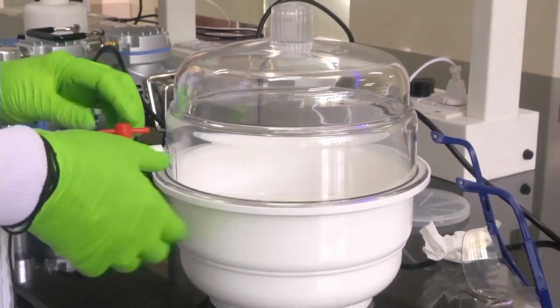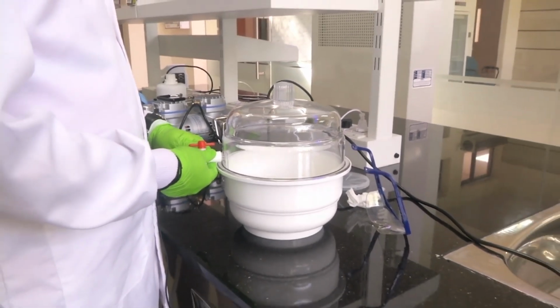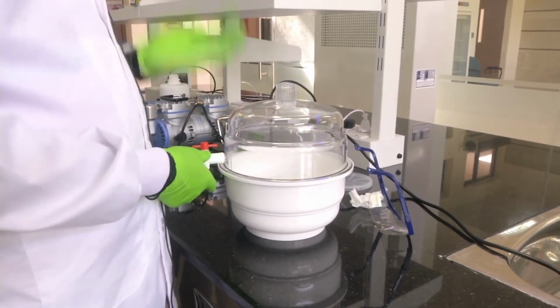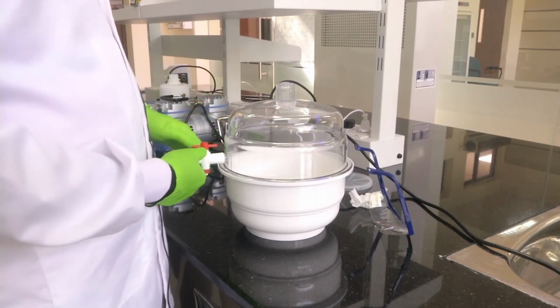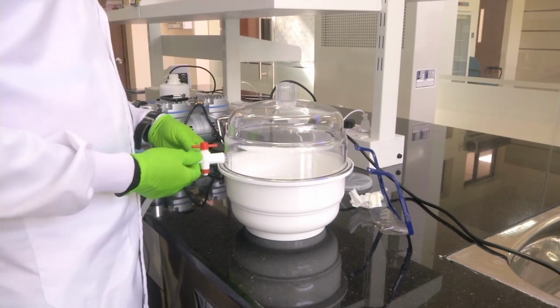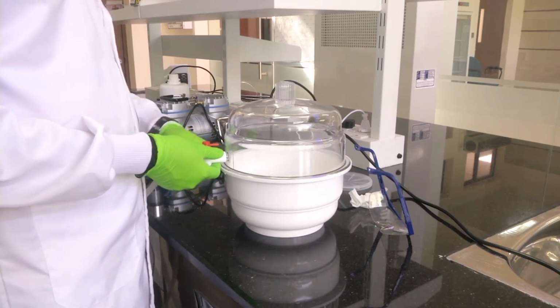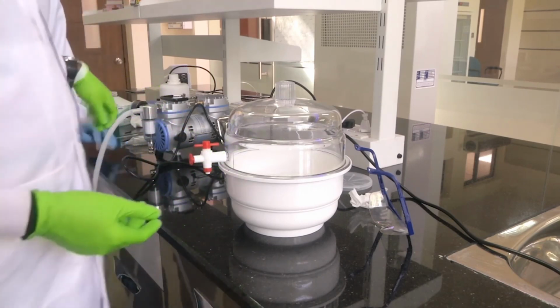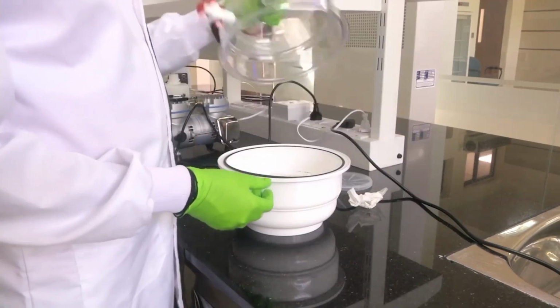So we have switched off the desiccator. Now we cannot directly take it out because it will create a shock inside, and the petri dish may vibrate or get thrown away because there is no air actually inside. So we are slowly depressurizing, removing the vacuum inside. So now air is rushing back into the desiccator. Once that is done, we are removing the desiccator.